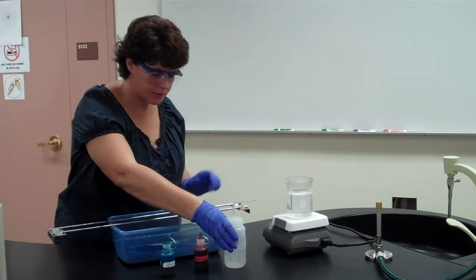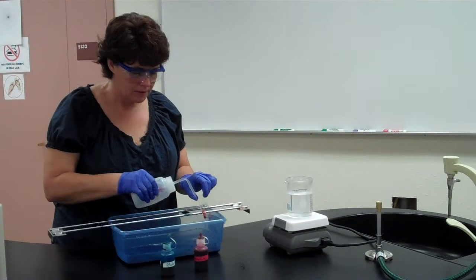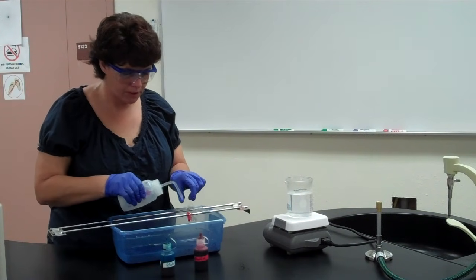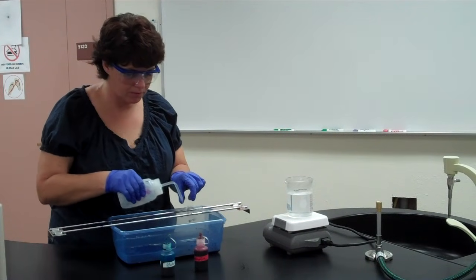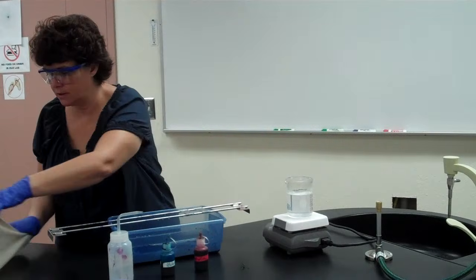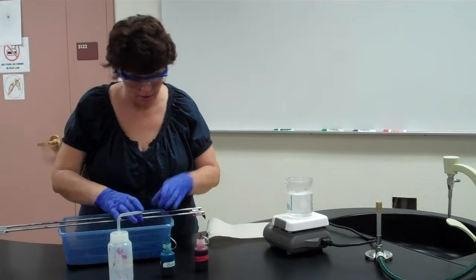Now you may also see, so after that's set its time, I'm going to rinse. So again, rinse, rinse, rinse. Don't be afraid, you can't really over rinse. Now you don't want to spray directly on the culture. And as we did before, we're going to blot dry.